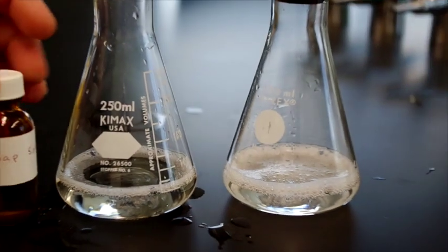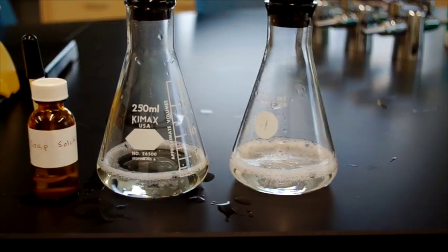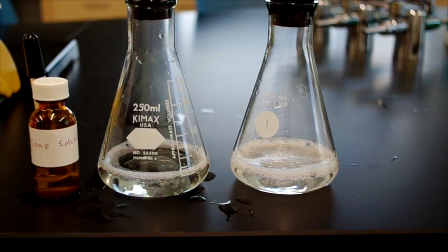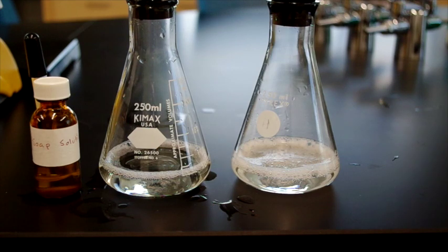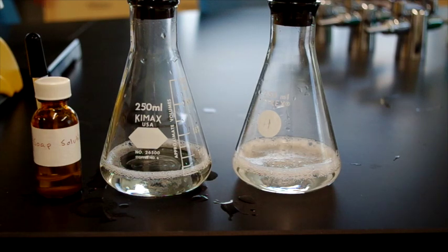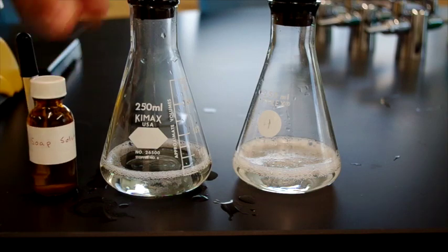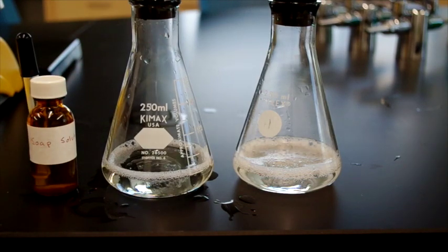If at home, for instance, you have a lot of calcium in your water because of runoff from various mineral sources, you might taste a lot of what tastes like dirt in your water, and it might make your soap significantly less effective at sudsing, which will make it more difficult to clean things, and also possibly give you kidney stones. So that's a fun little demonstration, and you'll answer some questions about that in your lab report.